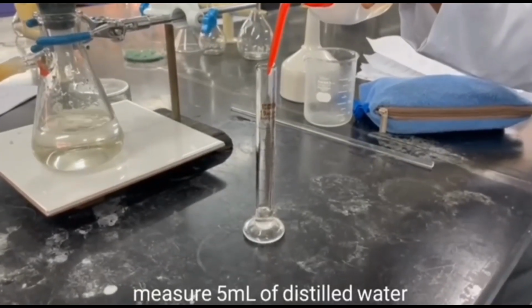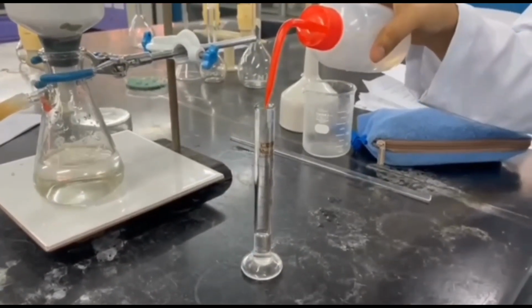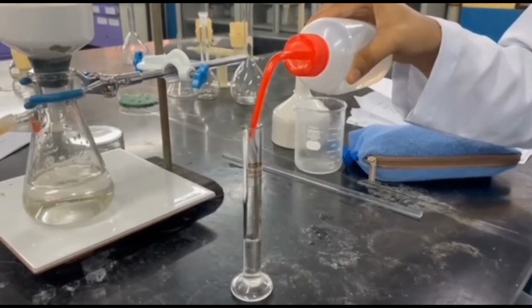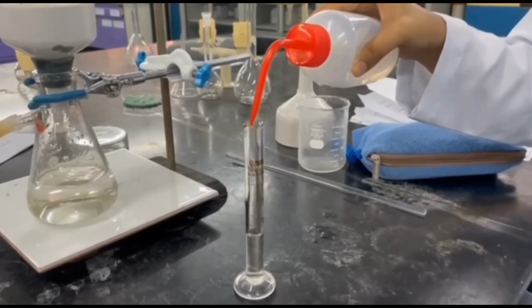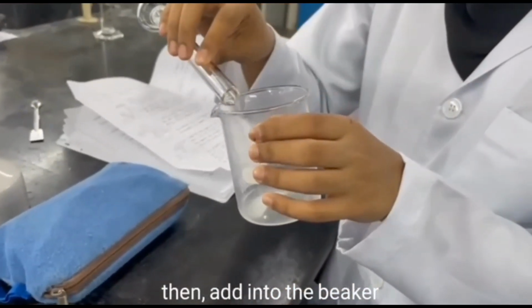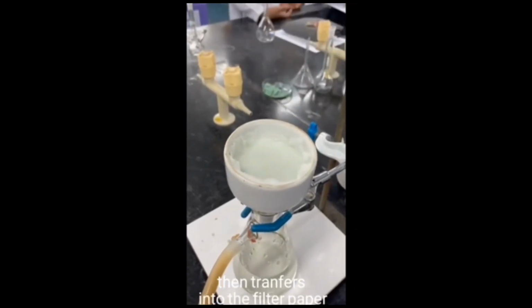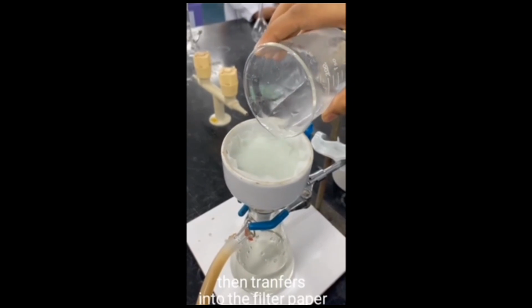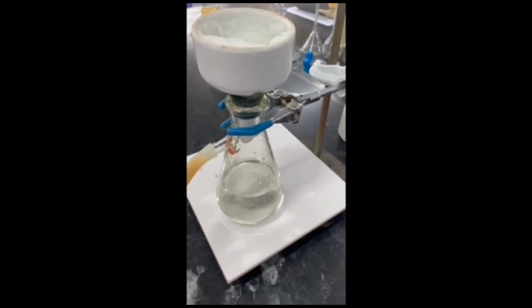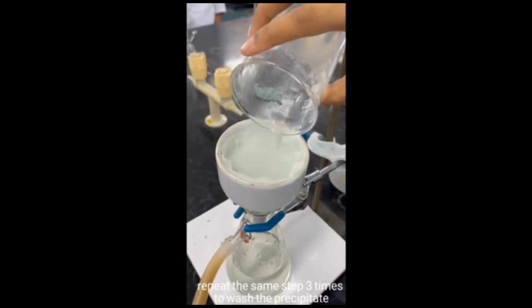Measure 5 ml of distilled water, which is to wash the precipitate. Then add it into the beaker, then transfer it onto the filter paper. Repeat the same step 3 times to wash the precipitate.